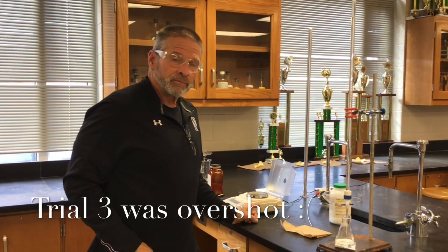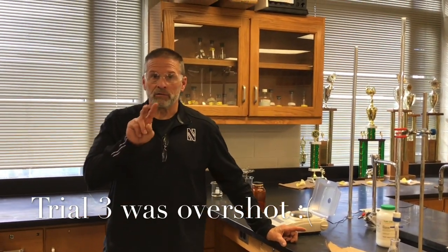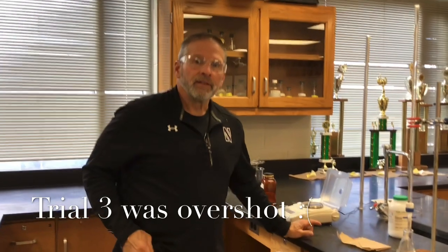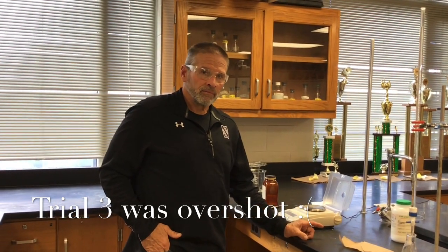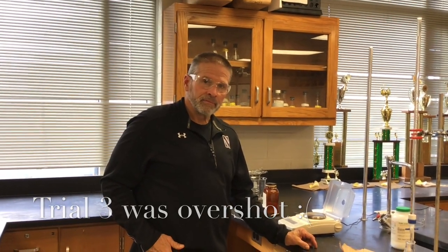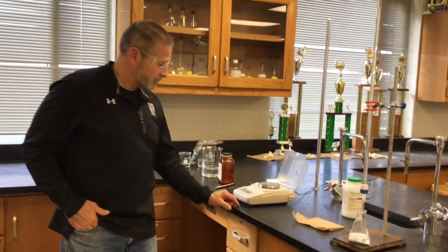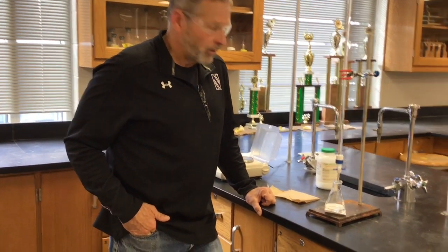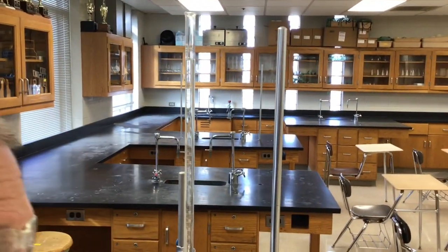Yes, students, trial 4 is happening right now. So you did trial 2. Yeah, because we did the fast sloppy one that was trial 1. That wasn't counted. Trial 2 was a good endpoint. Trial 3, we gave up on that one. We thought, well, let's do a do-over. So this is trial 4. The mass, we just did that and dissolved it, so you wouldn't have to watch and sit through that. 0.171 grams. Right. So the burette has been refilled to 0.00.